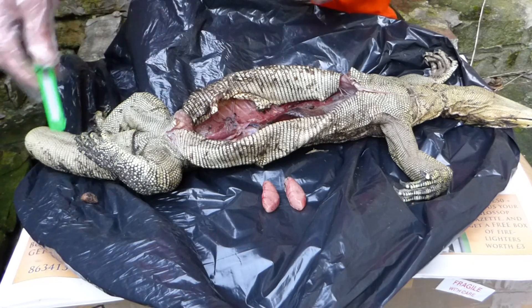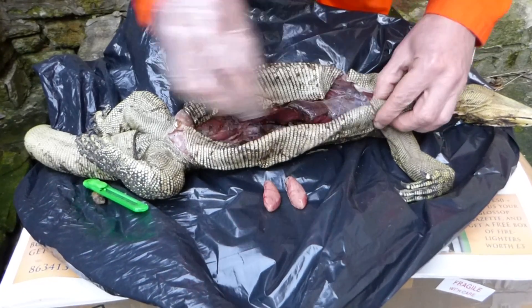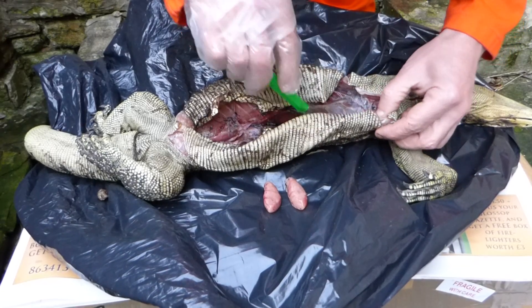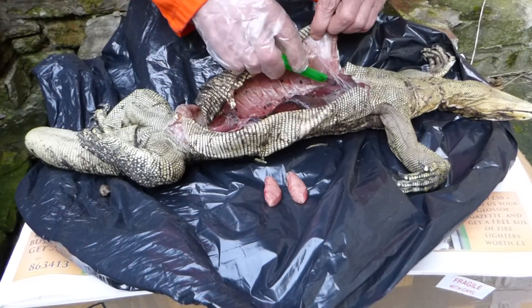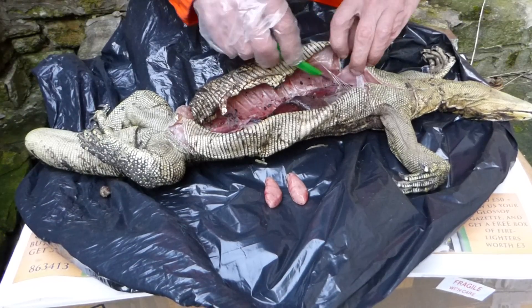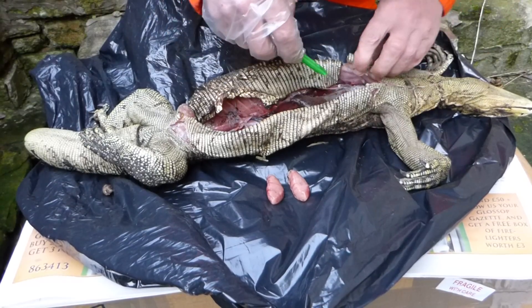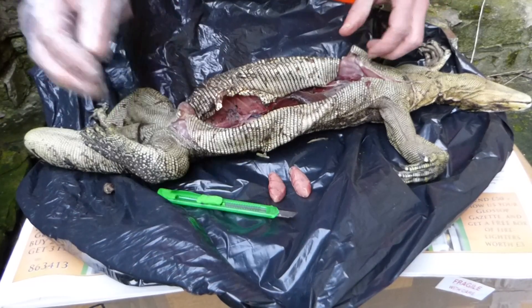Get that cover away. What we're going to do now... we will need this. There's a membrane that's basically separating the internal organs from all that fat. All we're going to try and do is get through that membrane, through all those nasty pipes.